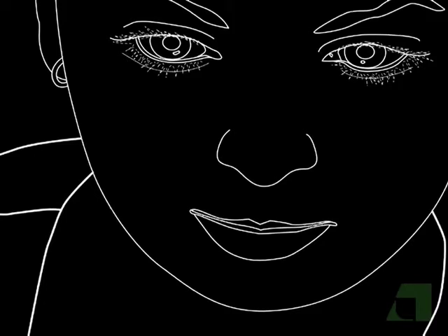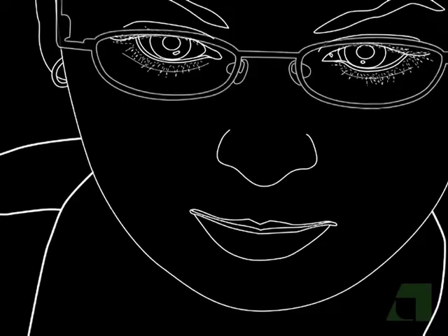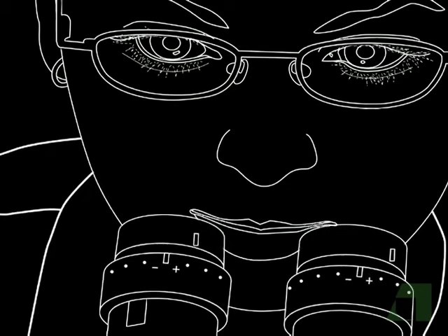Commonly, the right eye and left eye do not see equally well, even with eyeglasses. For binocular microscopes, you can adjust the ocular lenses for this diopter correction. How to do this will also be explained later.